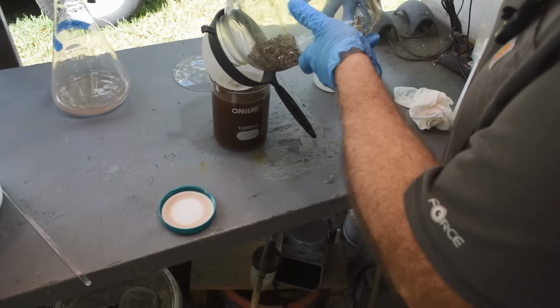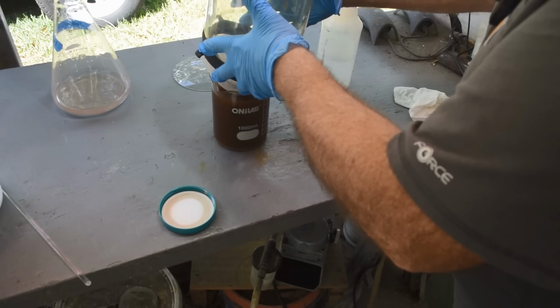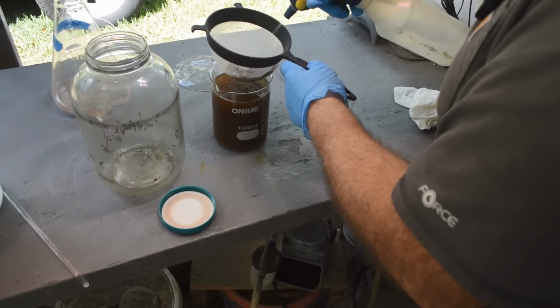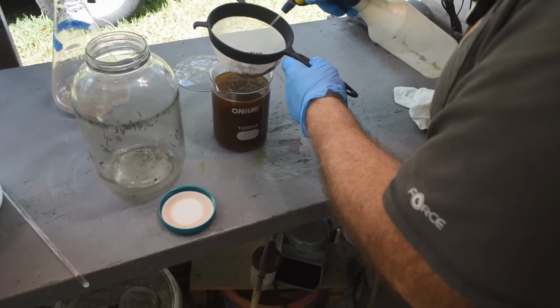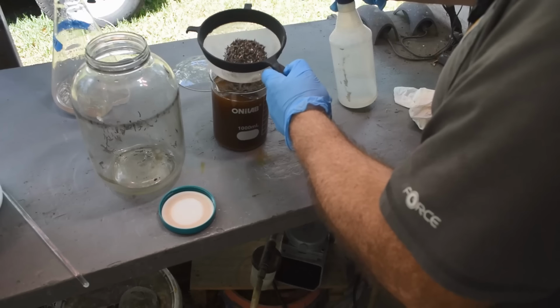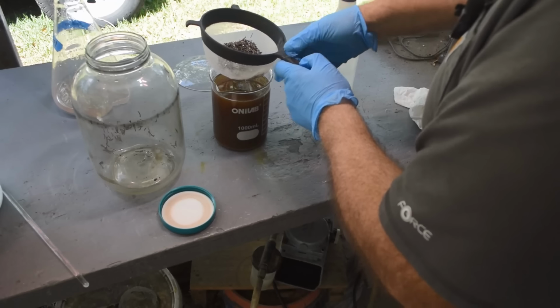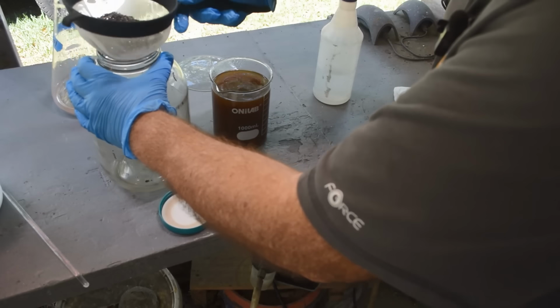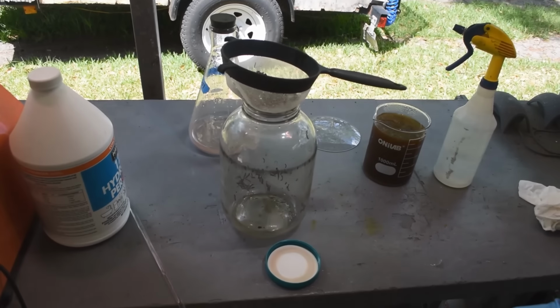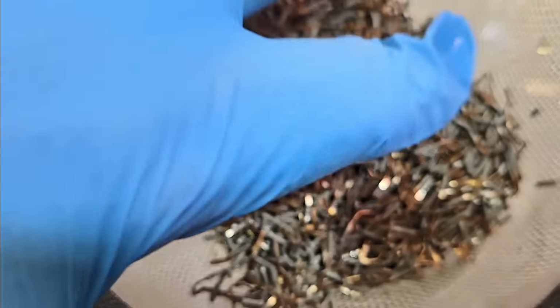Actually, you know what? Let me dump some of the pins out and we'll have a look at them close up. That's the way. Let me give you a close-up look at the phone and show you what's going on in that strainer. All right, it looks pretty much like last time. I still see a little gold here and there.